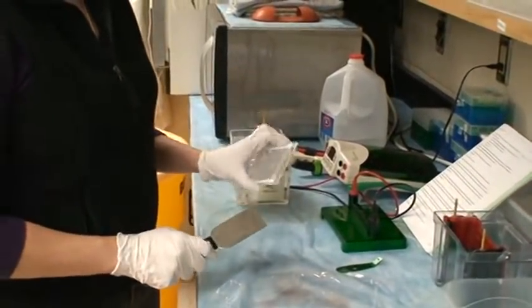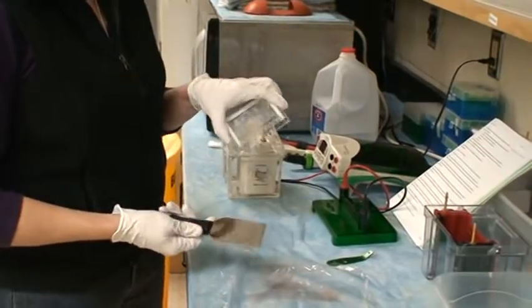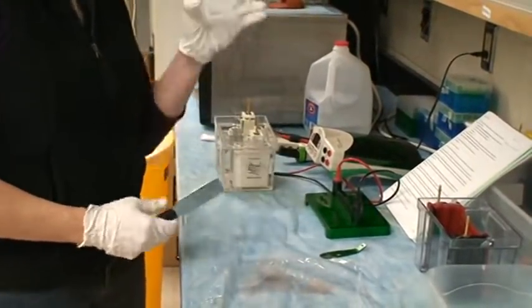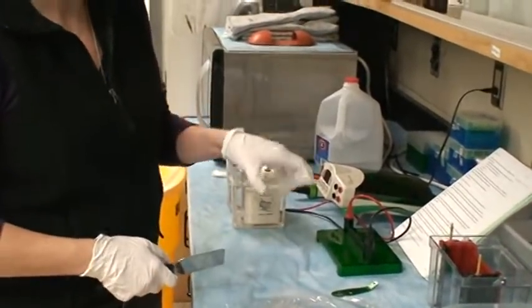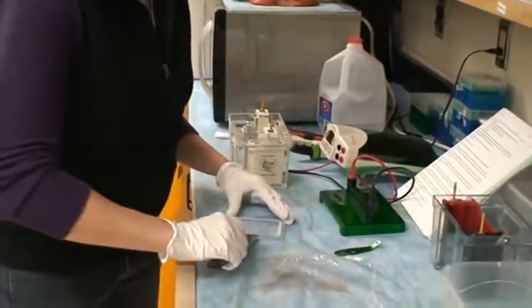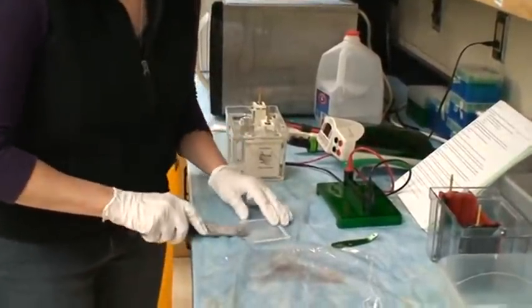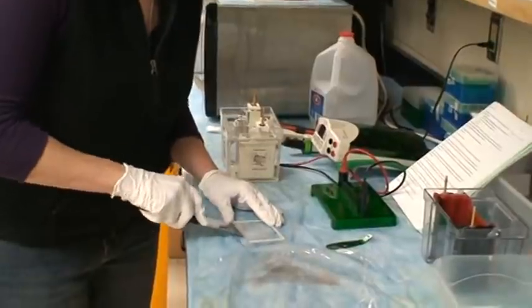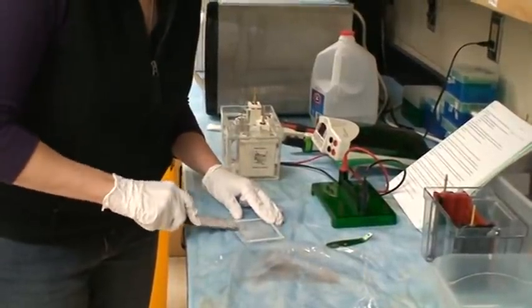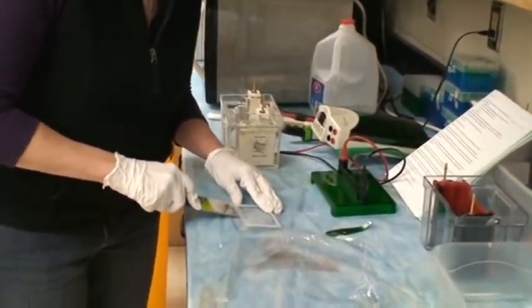You need to remember which orientation you loaded your gel. For this gel, I'm actually going to have to—this is how I loaded it left to right. I'm actually going to have to lay it down the other way to get the spatula between the two plates. And then you're just going to crack it up and separate the two plates.